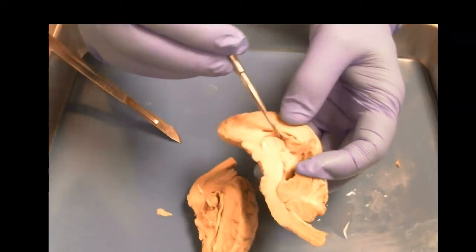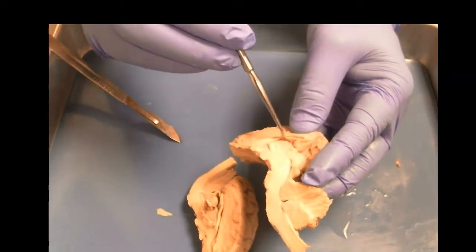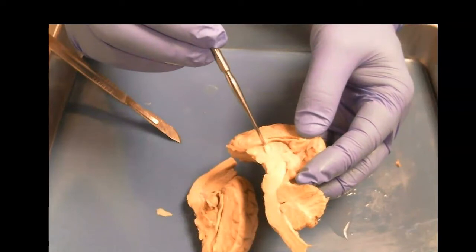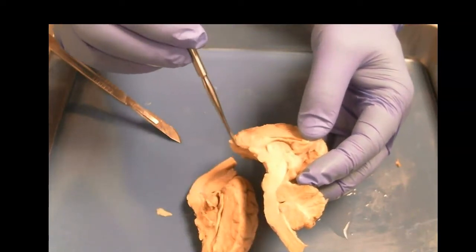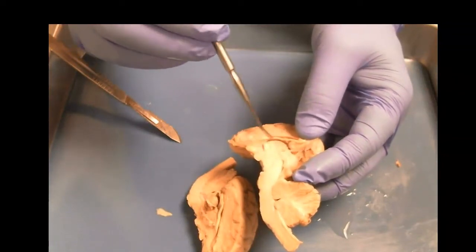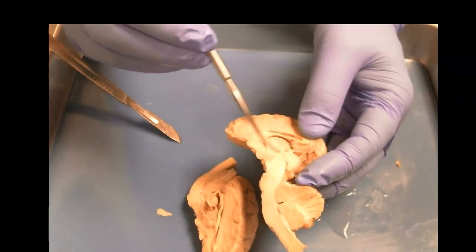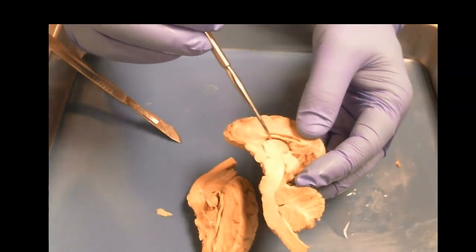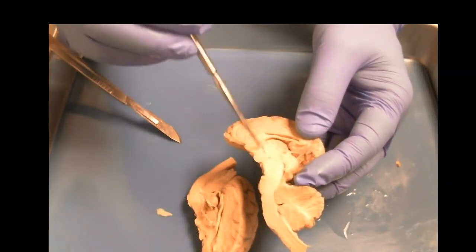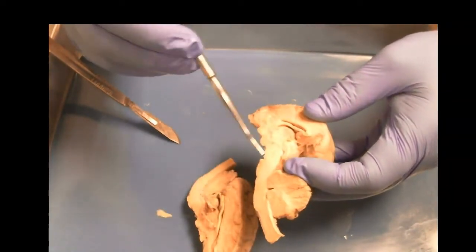Now, as we go through here, we can see the top of the thalamus right below the ventricle. And this tissue wrapping around the thalamus is the fornix. The fornix is also going to run into the hippocampus. And so there are a lot of these tissues that wrap around the thalamus. The striatum, globus pallidus, right? These are all functional, in this area here, but their function isn't quite as specified. Thalamus, white matter tracts connecting to everything.